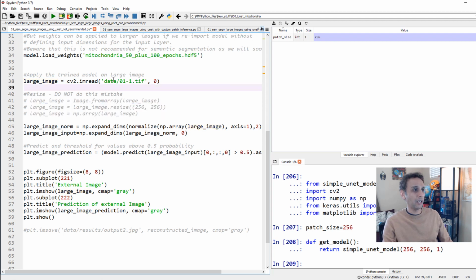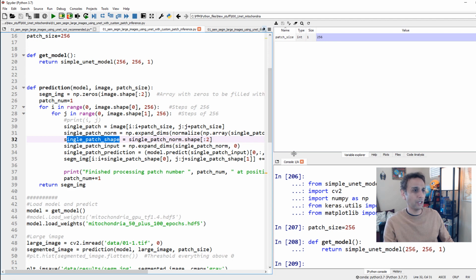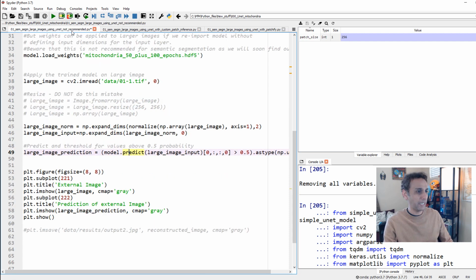But yeah, we read the large image and then we are expanding dimensions, normalizing, and doing prediction, right? That's exactly what we are doing. We are getting a single patch shape because we are using that shape later on down here. That's pretty much it. Otherwise, nothing else going on over there. And then I'm doing model.predict on my single patch, and also doing above 0.5. I already explained that, right? This is exactly this line that we're talking about.